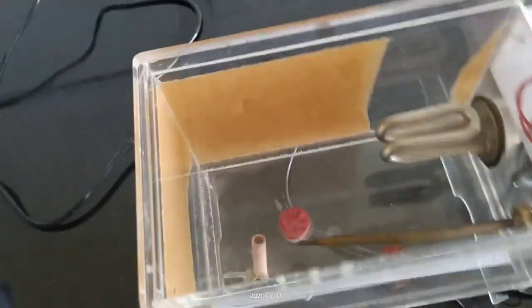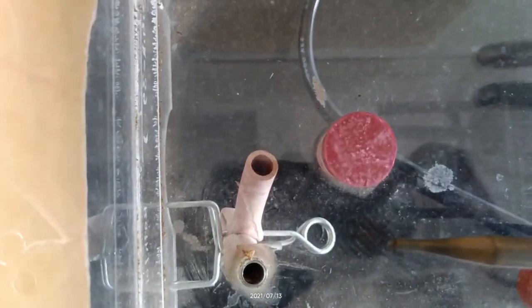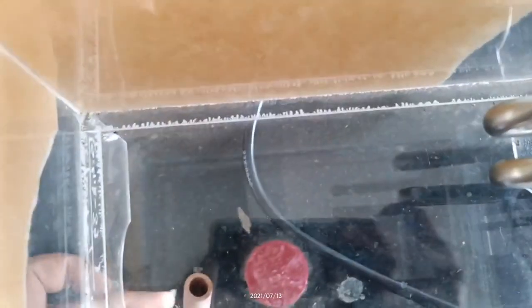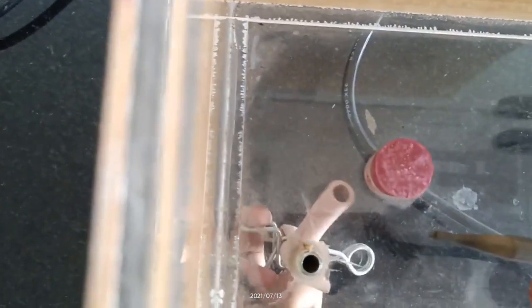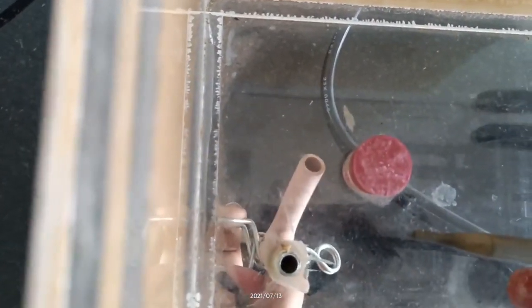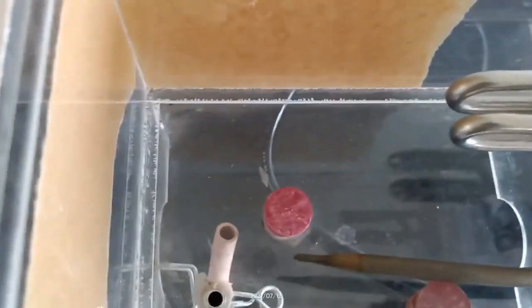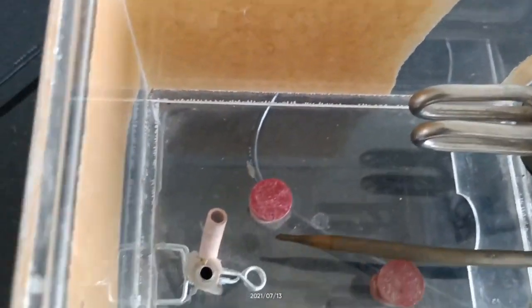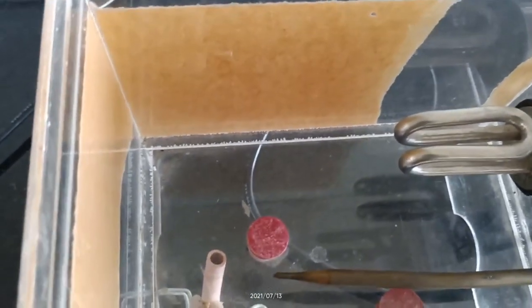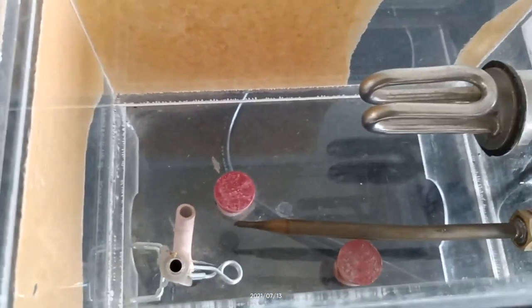Next is the water inlet and water outlet. The clamp is pressed to withdraw the water. This water inlet and outlet is used for removing water from the water bath after an experiment, or to fill the water bath with water.